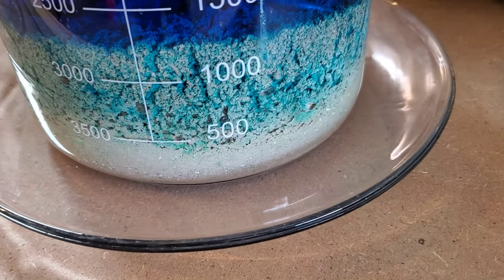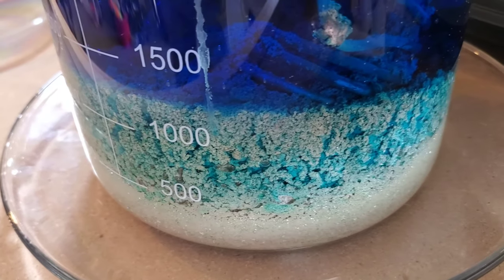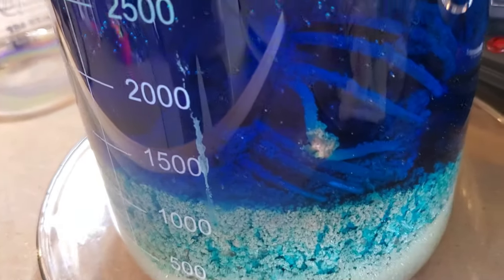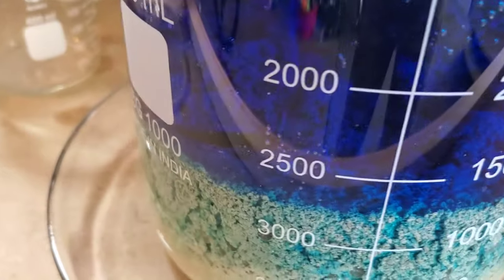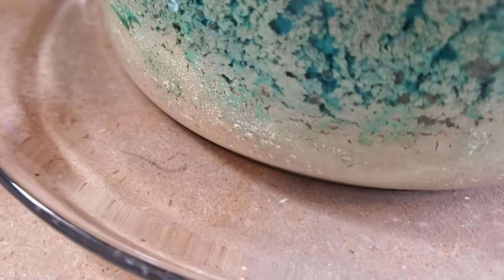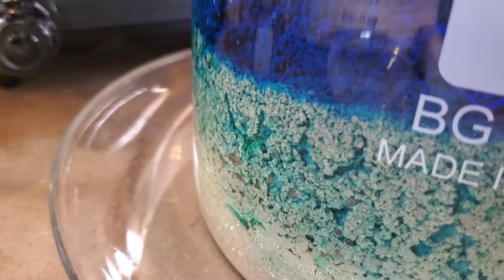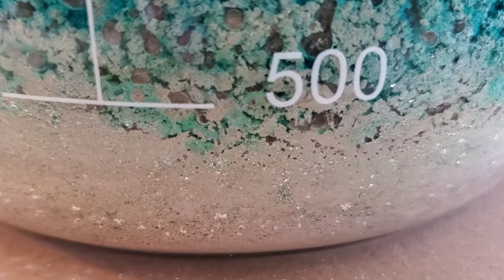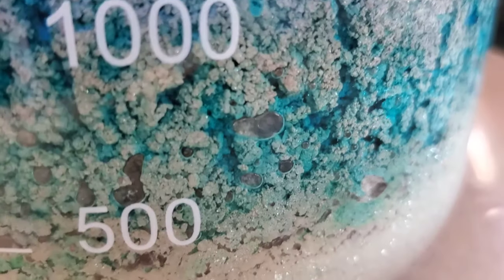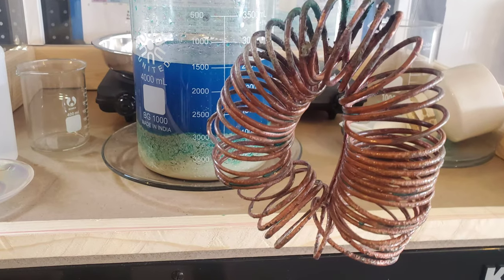All right, here you can just see the various layers of silver crystals as they fall into the bottom of the beaker with the weight of it concentrating most of the silver towards the bottom. And then the upper portion is a little bit lighter and has still some of the, at this point, copper nitrate in between the crystals.